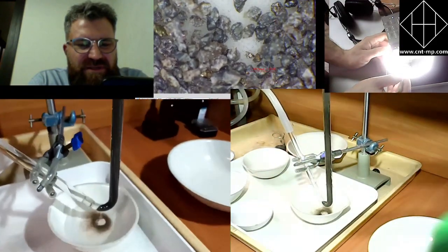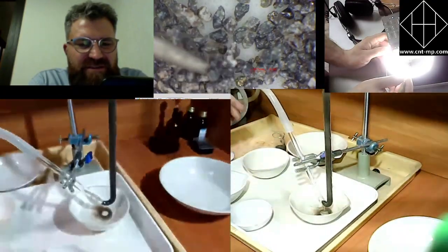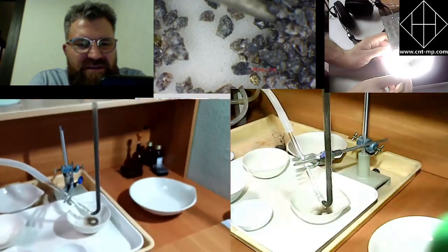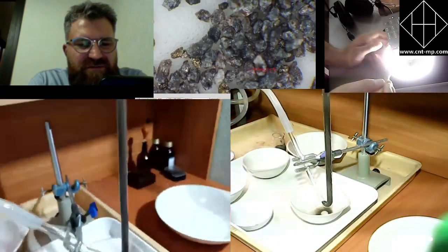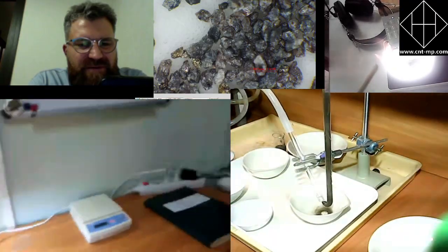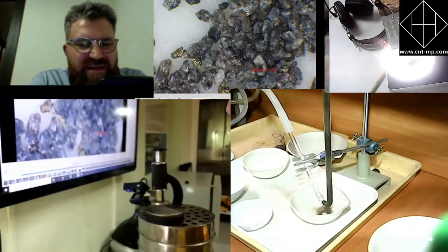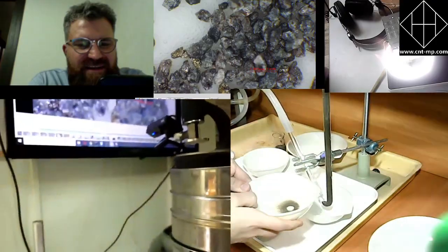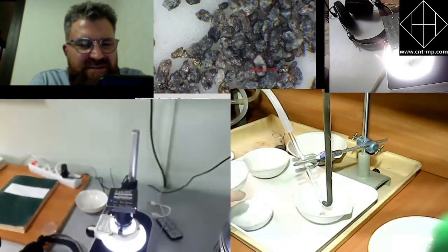You remember that piece of rock that it was before? Definitely didn't look really like crystals. This looked as if this is monomineral substance, very compact. Here you can see that it was all composed of different types of mineralogy. And you see they are very small, though they are coarse-grained enough, but they are very small. They are easily attachable because of their statics.